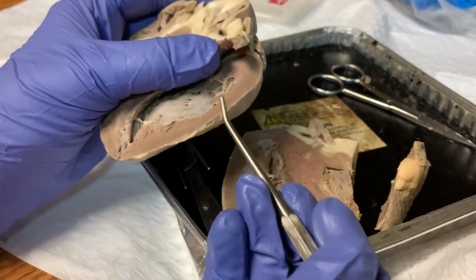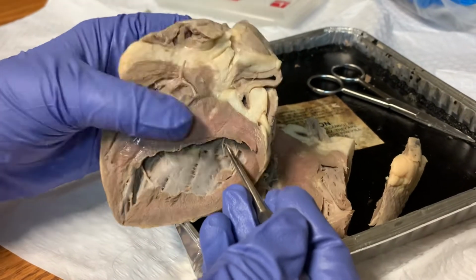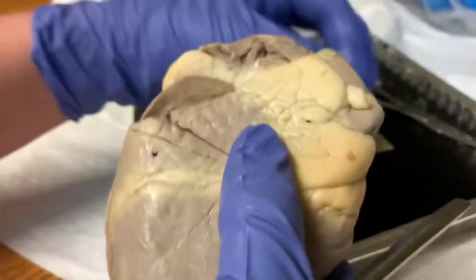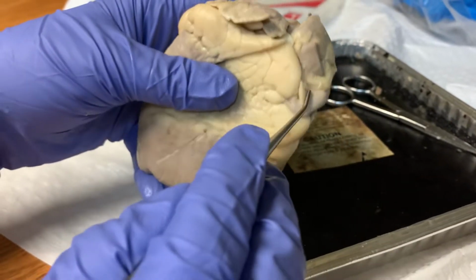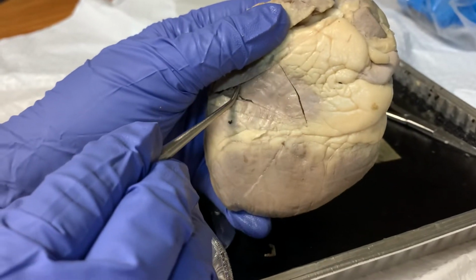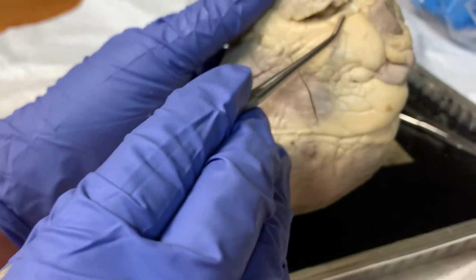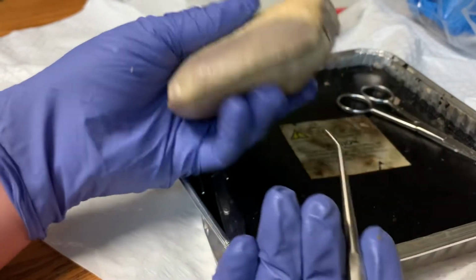Although the heart is constantly full of blood, it still requires its own supply in order to function properly. The coronary arteries are responsible for this. Theoretically, we would be able to see them in these locations. The left and right main coronary artery would be here, and the outline where they would travel kind of follows along this line here. These further divide into smaller branches supplying the entire surface of the heart.